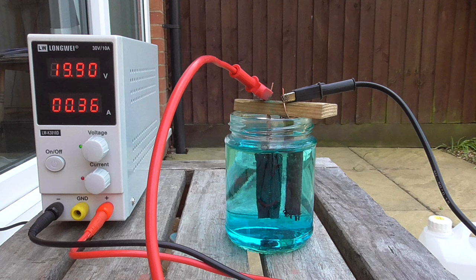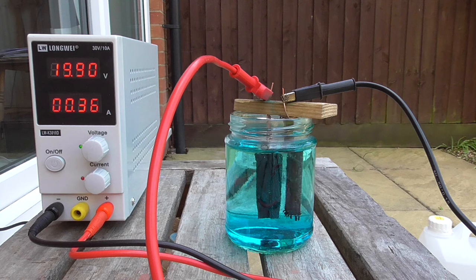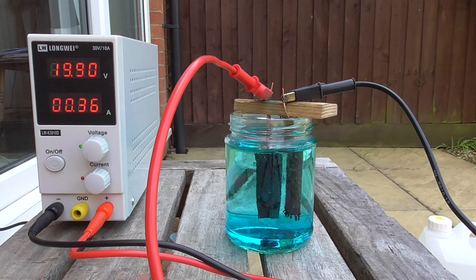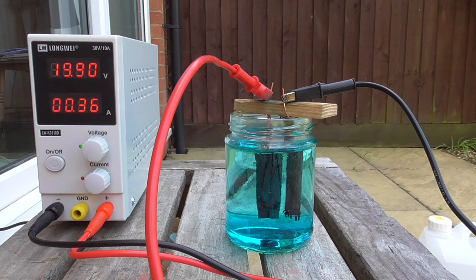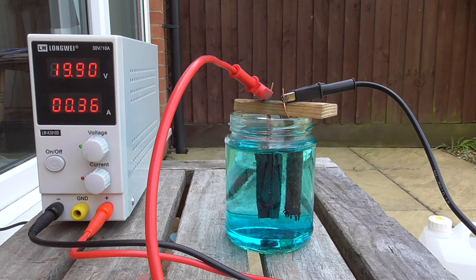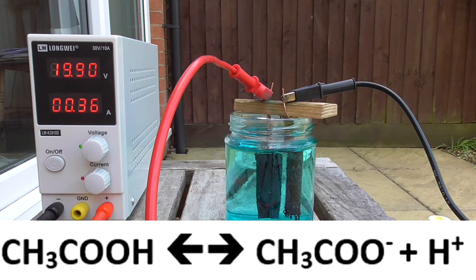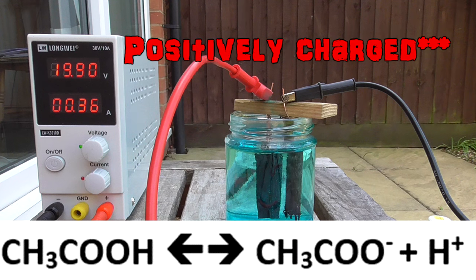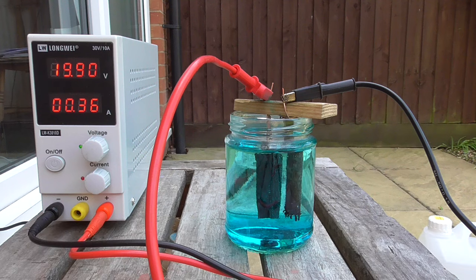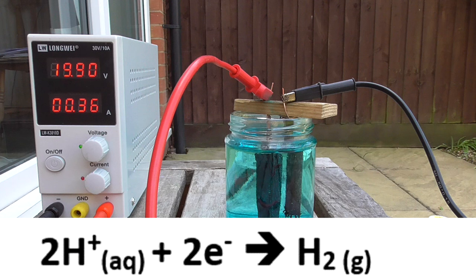I'm just going to assume that you know the basics of electrolysis — that being we have an anode and a cathode, which we pass electricity through in between through a solution. In this case, the solution is acetic acid, and our electrodes are graphite and copper. The cathode is the negative electrode, so let's look at what's happening there first. The acetic acid gives us a bunch of hydrogen ions in solution. These hydrogen ions are positively charged, which means they're going to be attracted towards the negatively charged cathode.